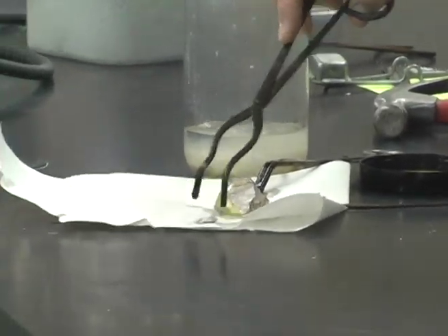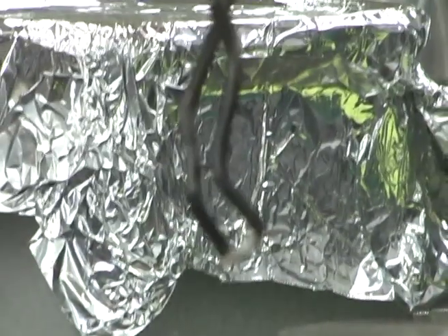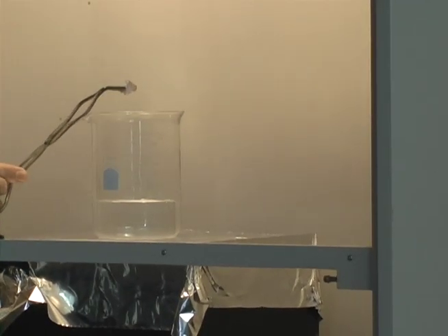Yeah, it's sodium. It's a silvery metal. It's very shiny. When you cut it, it's kind of oxidized. Let's look at it again here. Did you bring this up now? No.